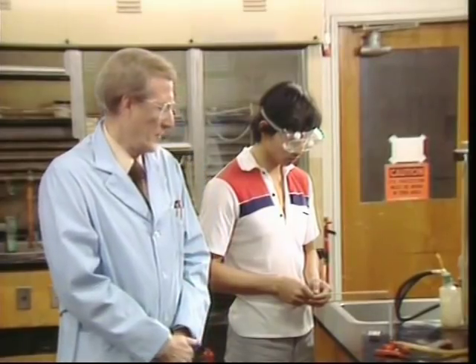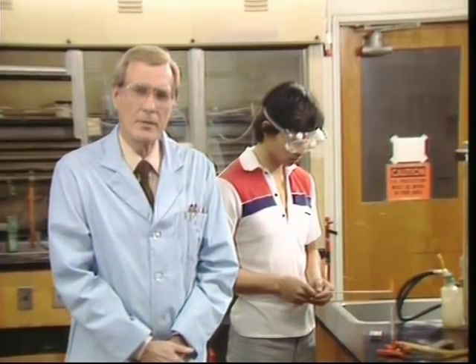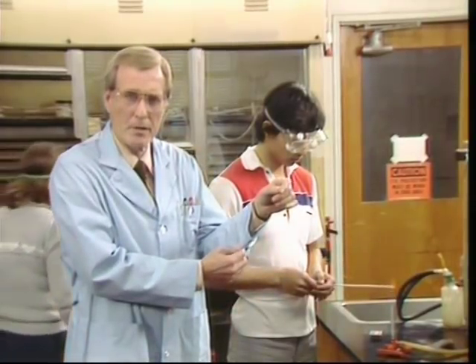Very often you will have to use some type of heat source in your lab work. Heat sources are inherently dangerous. If you're using open flames in your lab, be especially careful. Never reach across an open flame. Your sleeve could catch on fire through this carelessness.